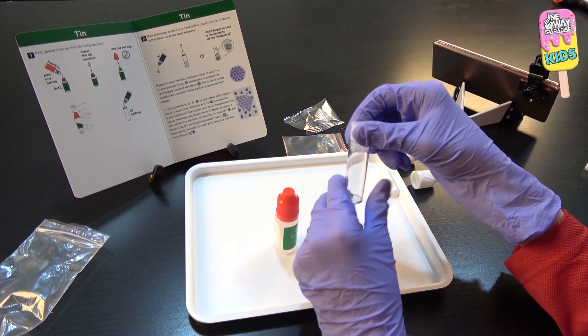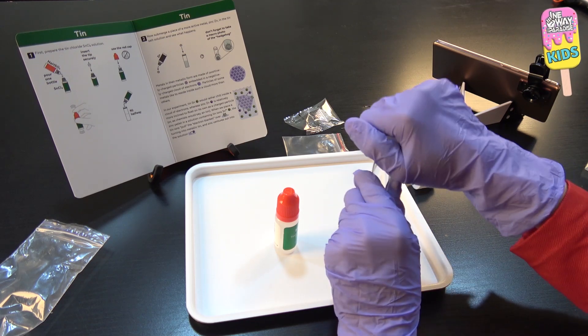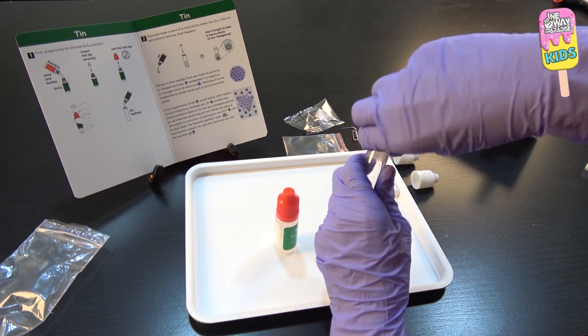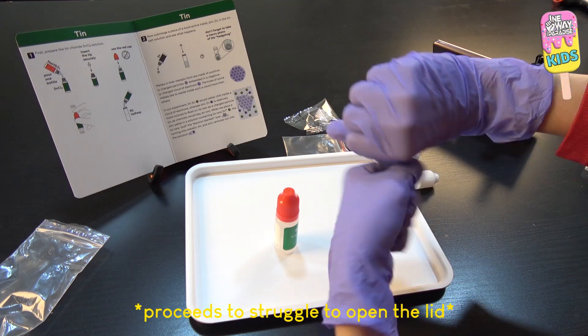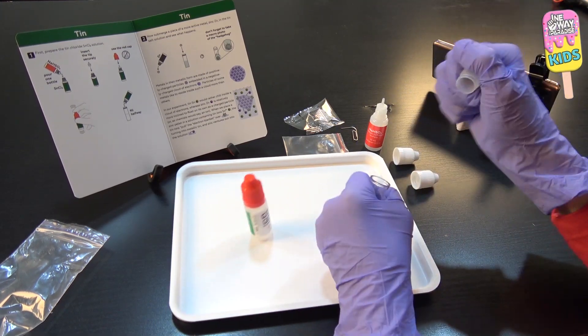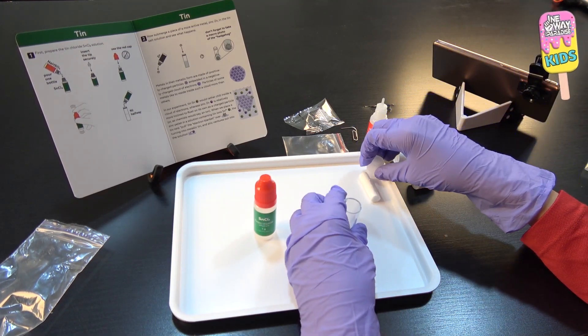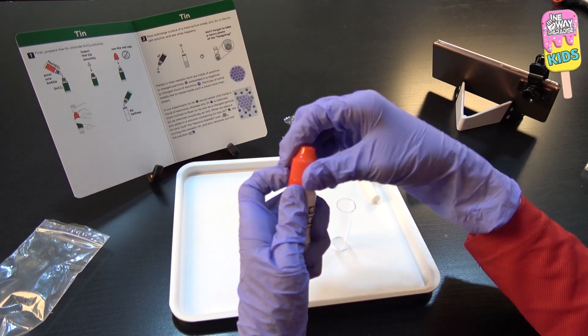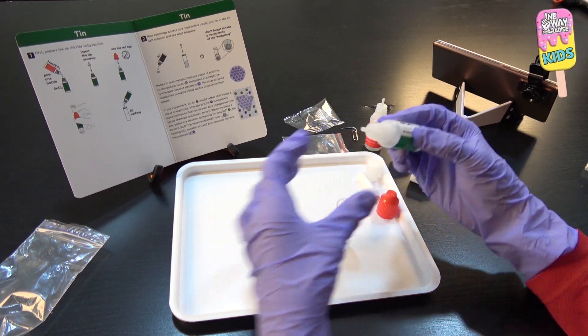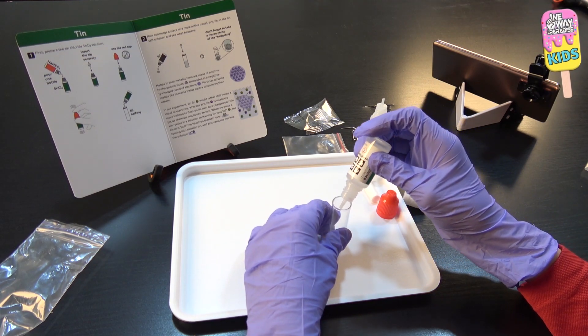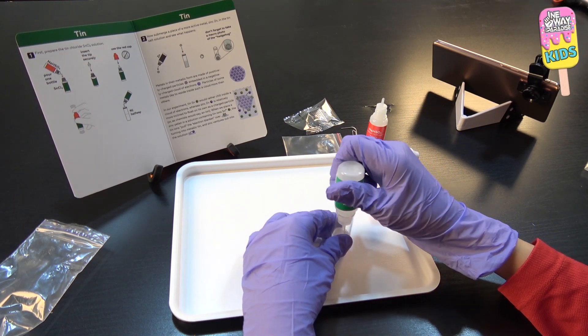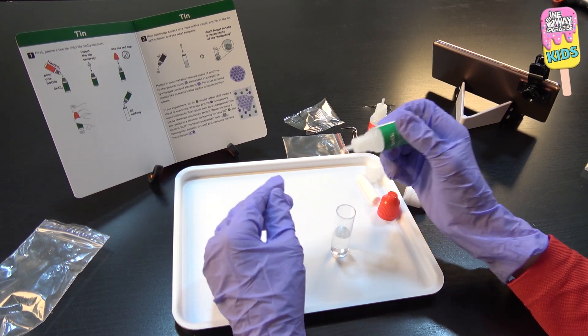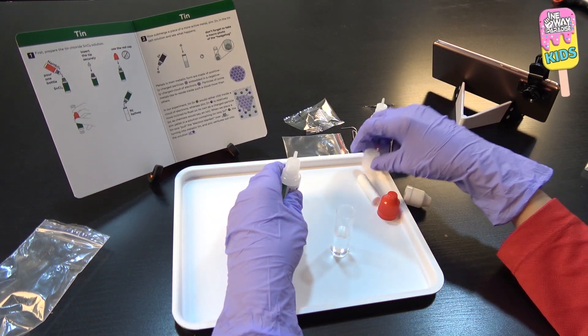Okay, so now I will fill this bottle halfway. If I can open it. And I'll fill this halfway. There, that's about enough. So and I'll just close this again.